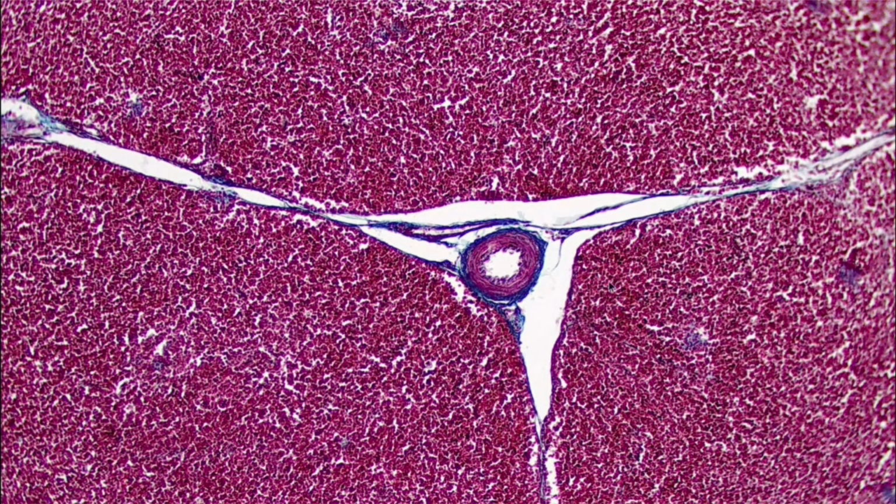This is one of my favorite slides, but I'm going to show you a few different things about reticular tissue and why I really want to emphasize coming into the lab and looking at the slides yourself, because there's lots of variation within slides, and so if you're only ever looking at one example, that's not really going to do you good. It's not going to help your studying.